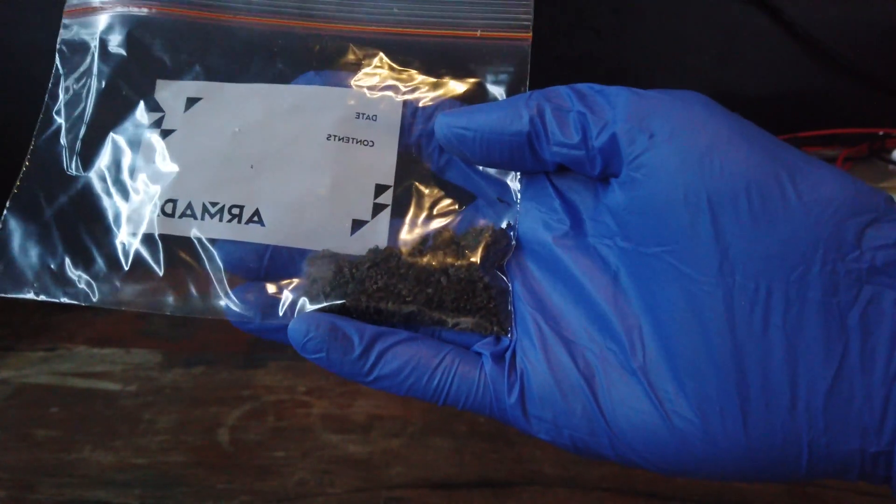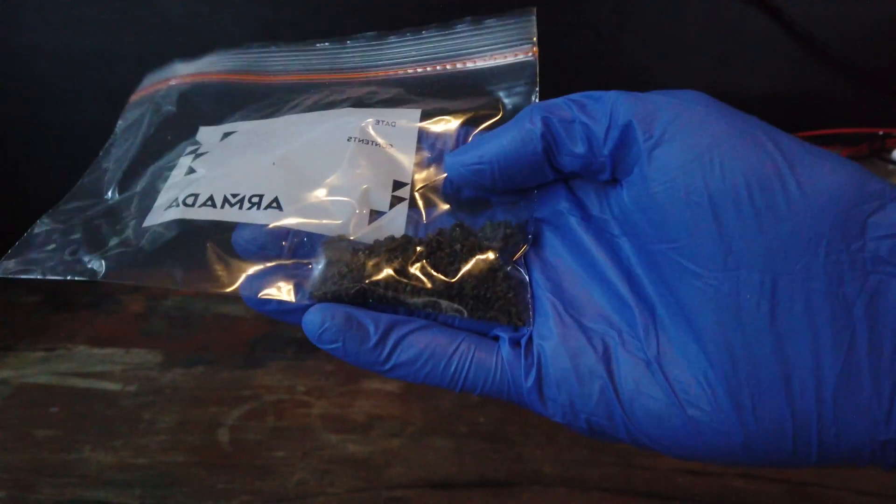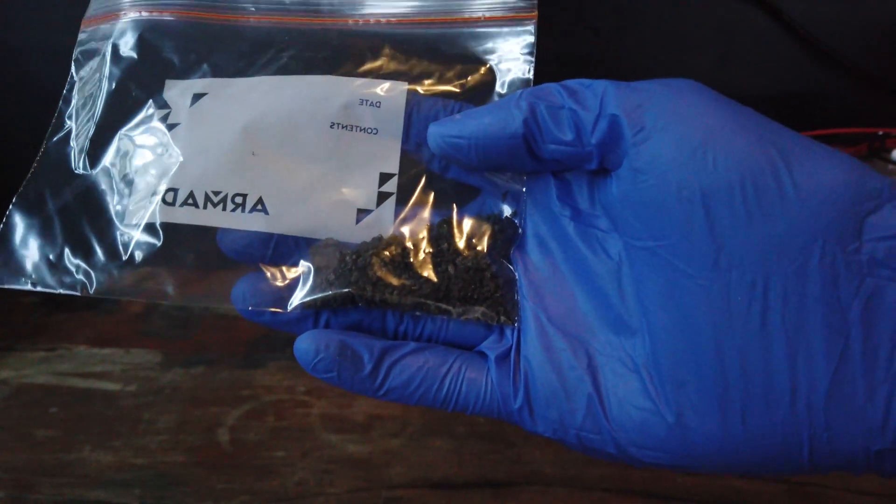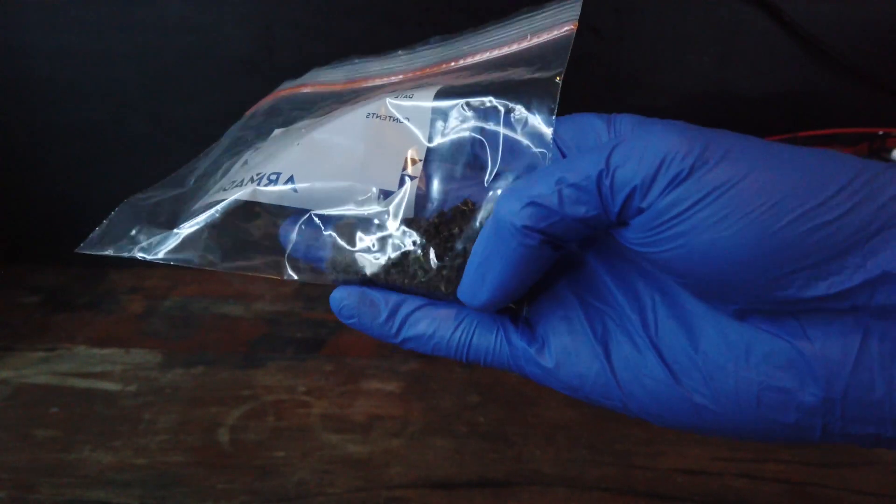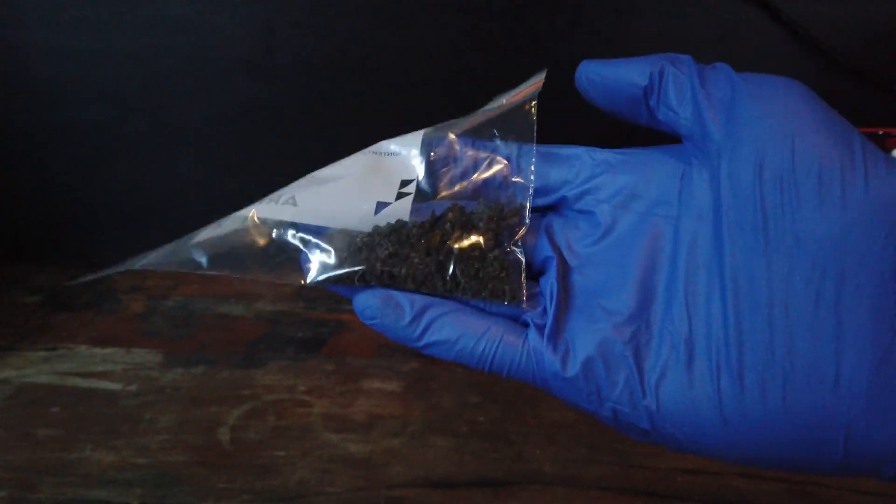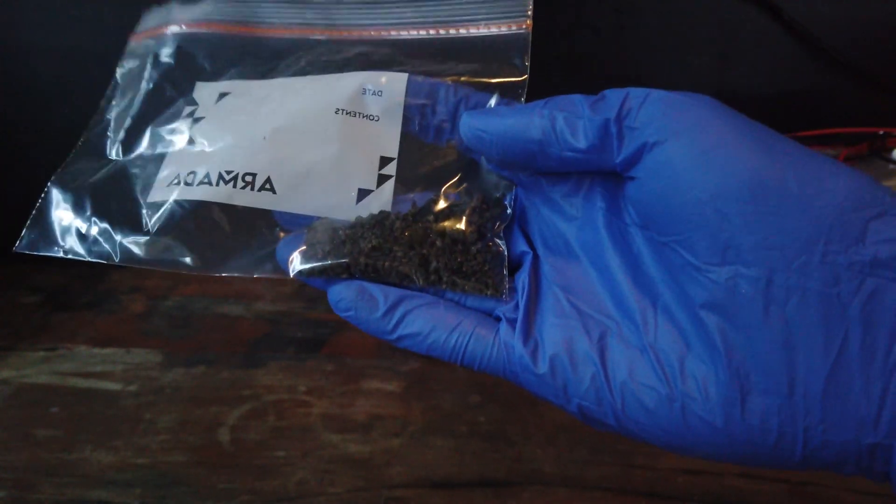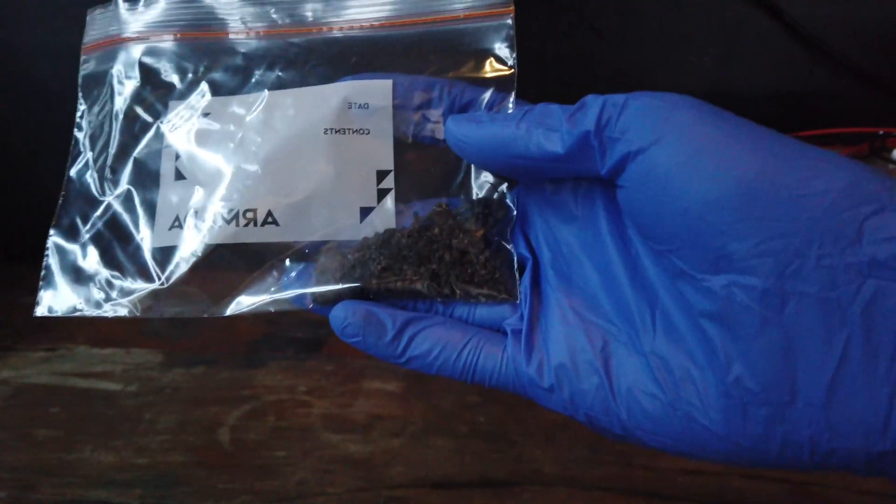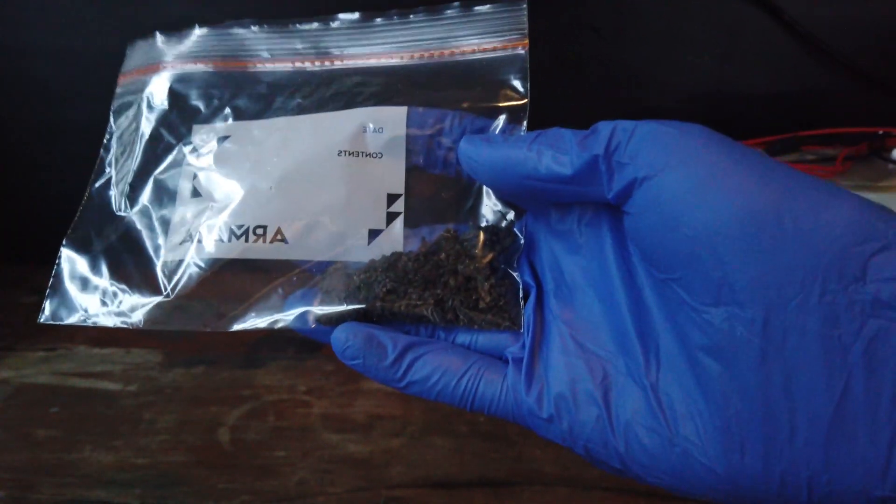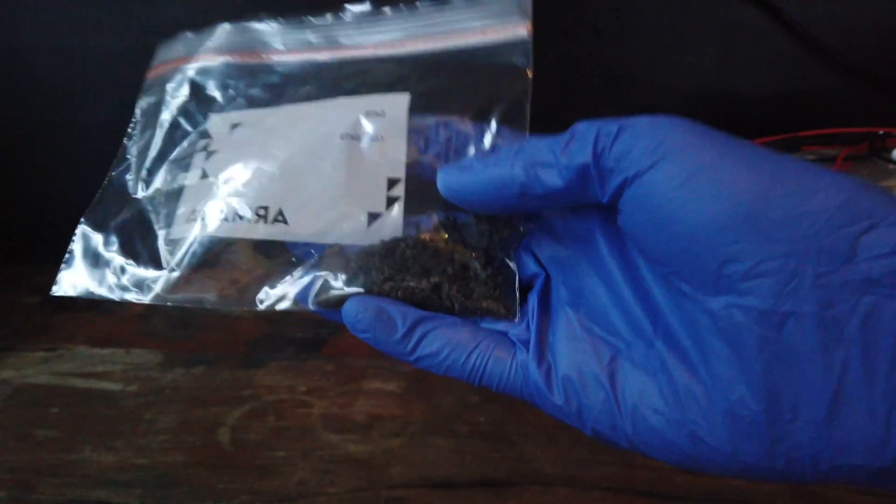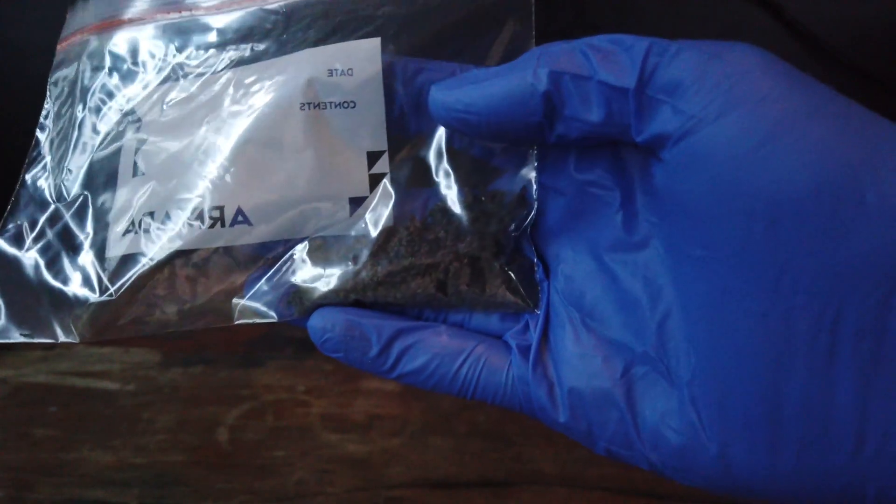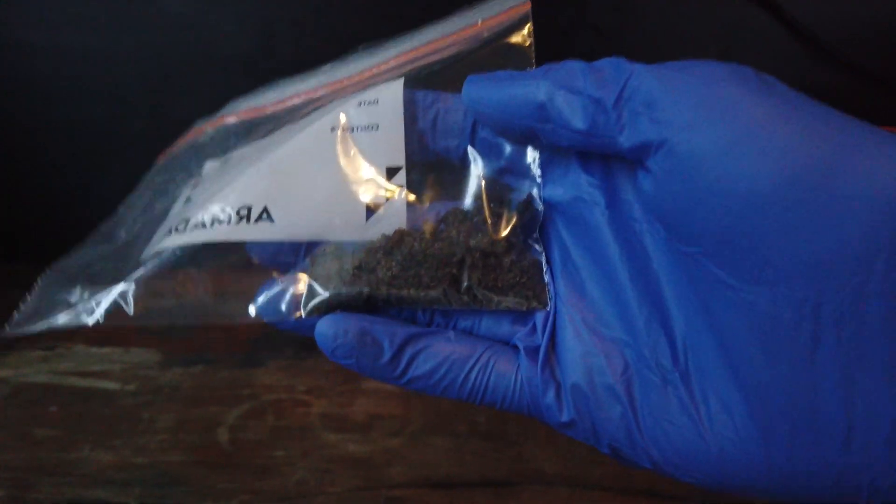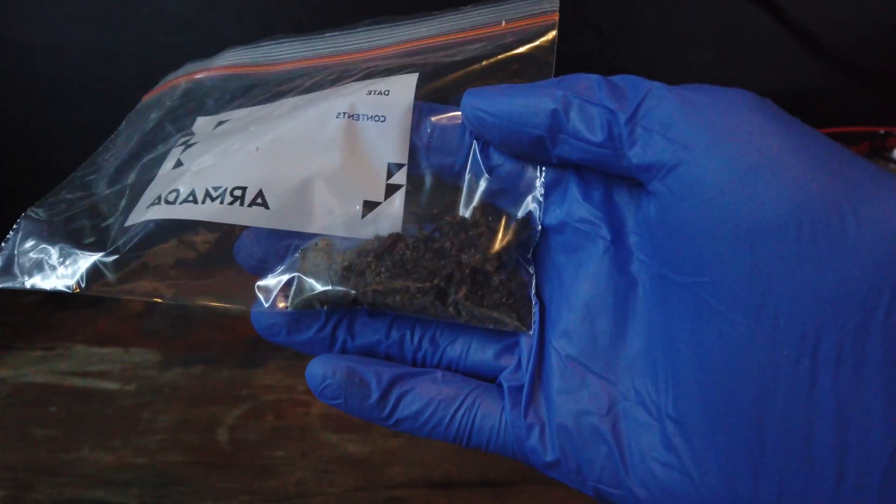And look, after everything's processed, and I was able to retrieve a whole bunch of metal actually out of the electrolyte using a magnet, we have extracted, over two weeks, 10 grams of a cobalt-nickel mixture. So, it's really not much. As I said, it's horrifically inefficient. But we did get cobalt and nickel, and we will separate the two in a future video. So, a bit of a short video for today, but we will finish this project a bit later. See you then.